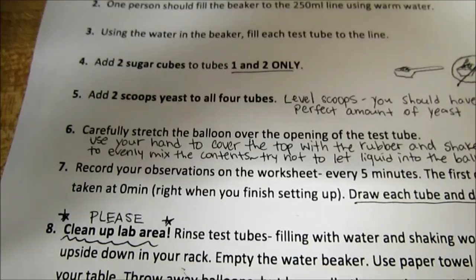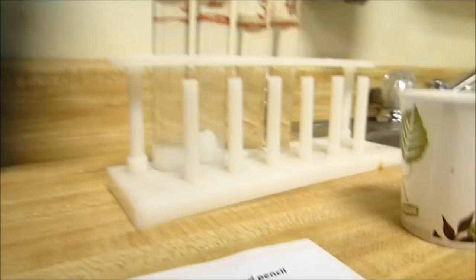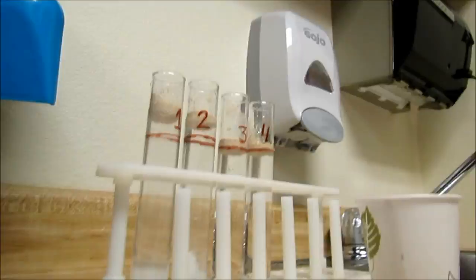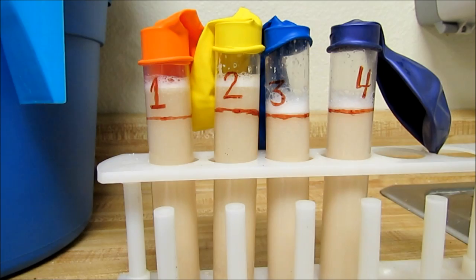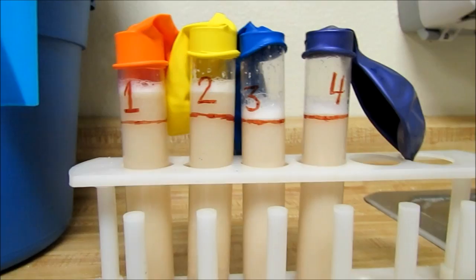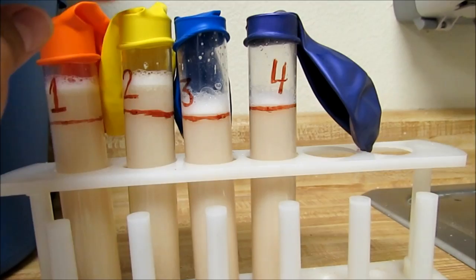Okay, now my next step is to put the balloons over the top of the test tube, and I'm going to shake them up to mix the contents of each tube there. Okay, now all four tubes have a balloon over the top of them, keeping them nice and sealed. And then they've also now been shaken.